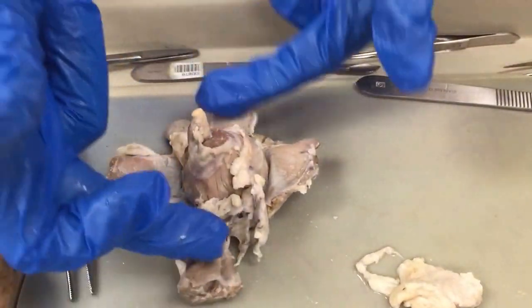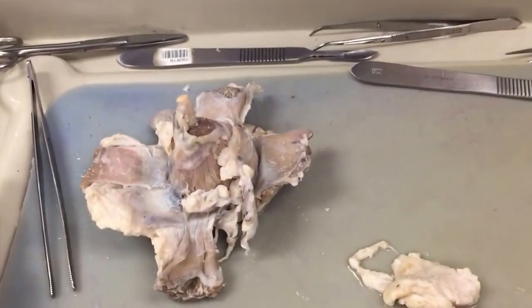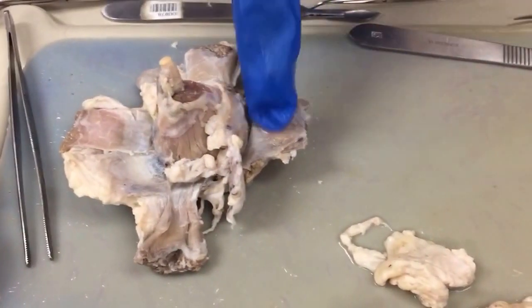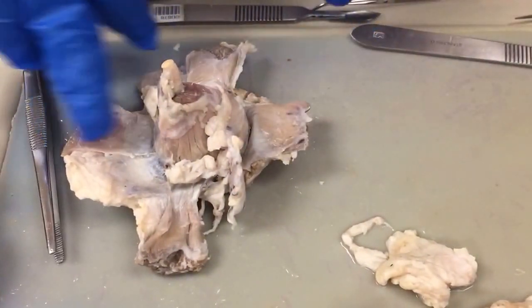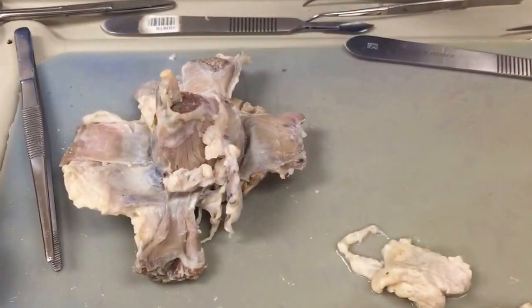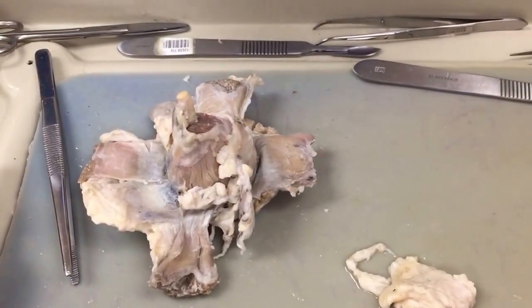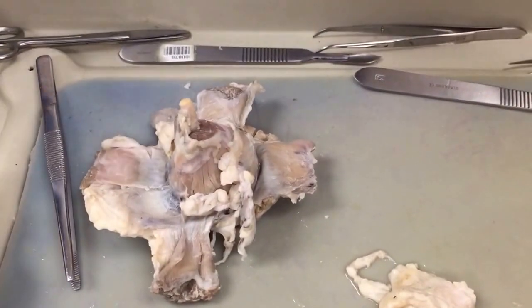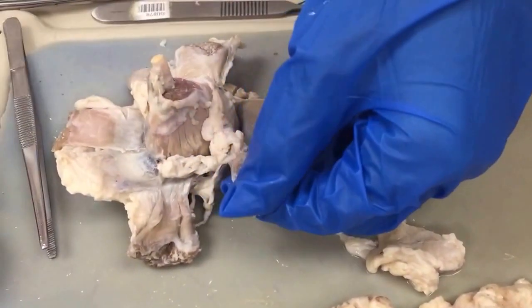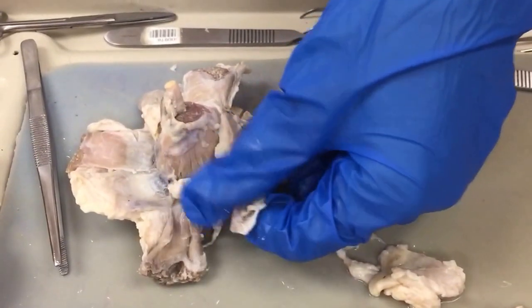So we have 2 vertical muscles here. Those are the dorsal and ventral rectus muscles. Then we have 2 muscles going laterally, our lateral and our medial rectus. So dorsal and ventral, lateral and medial rectus, and then we have our obliques. Just like the obliques in the abdominal area, obliques go at a diagonal. And then we have the one over by the lacrimal gland, the levator palpebrae superioris here.